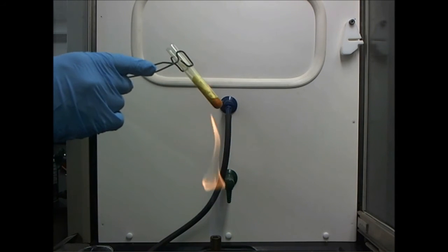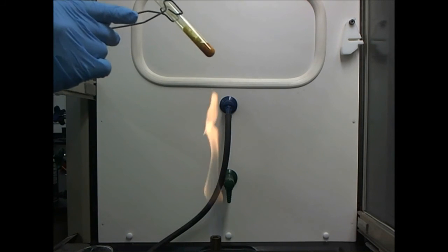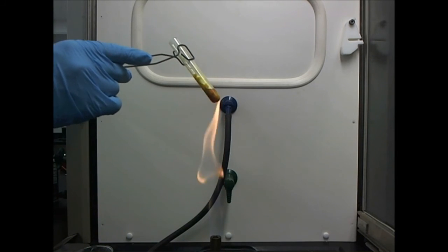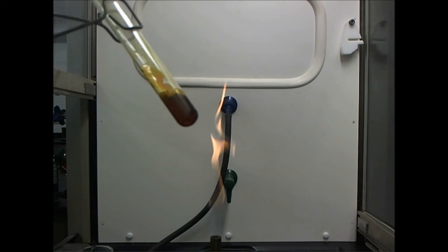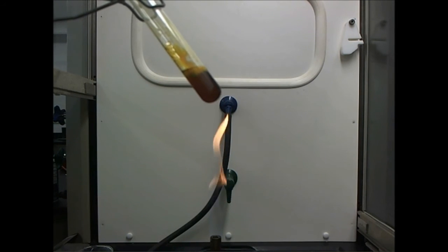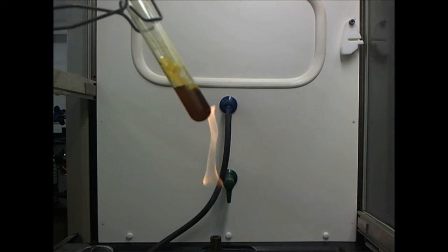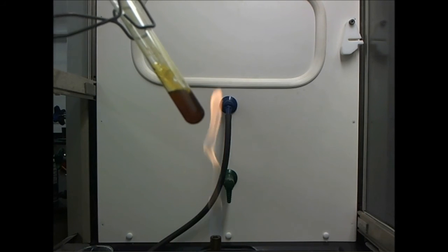You can see already that there's a dramatic color change at the bottom of the sulfur. As I add energy to it and change the arrangement of the atoms, it goes from a yellowish color to a deep red color. As I continue heating the sulfur, you'll see that it changes to this reddish-black liquid that is still sulfur molecules, except now they're not arranged in a neat, orderly, well-packed crystal.